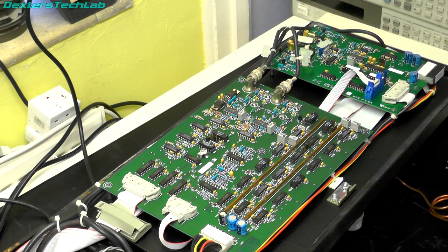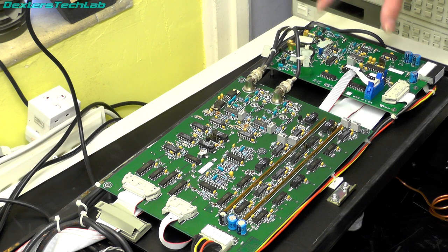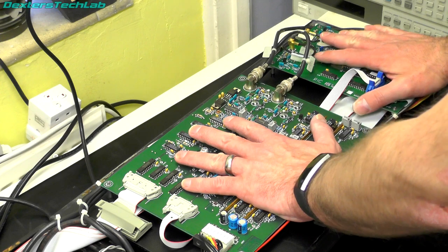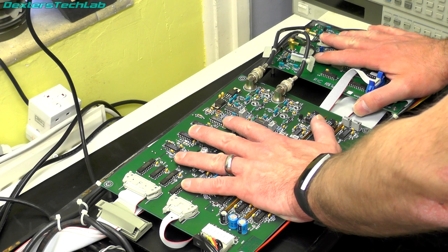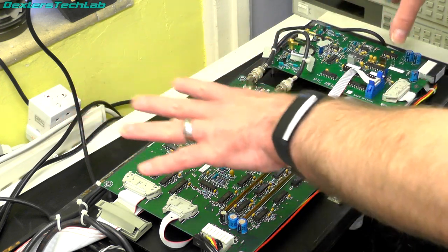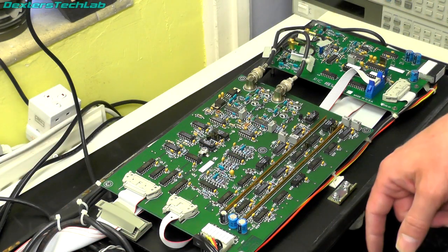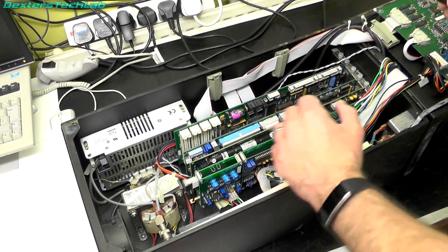One connection will be supplying the supply voltage to the photo multipliers and one will carry the actual signal. I suspect this board is some kind of preamp for the signal, and these two boards probably do signal conditioning and discrimination. That then gets sent down to what is quite clearly the digital processing section, so there's quite a bit going on in here.